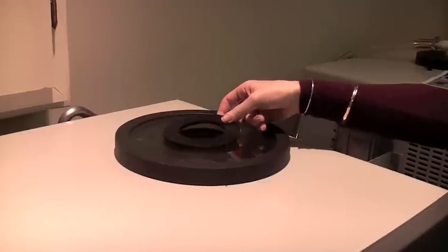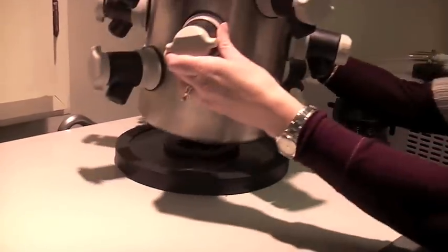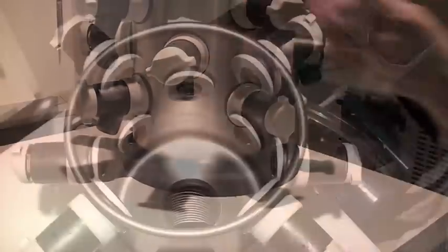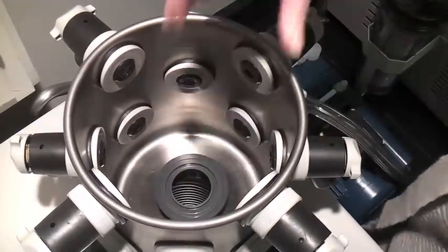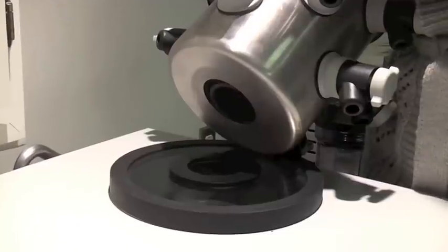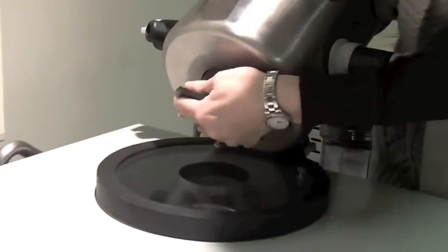To install, place the rubber gasket over the hole in the collector lid, ensuring that the gasket is centered. Place the collar through the hole in the drying chamber and through the gasket. Lifting the drying chamber slightly may be beneficial to ensure proper insertion through the gasket.